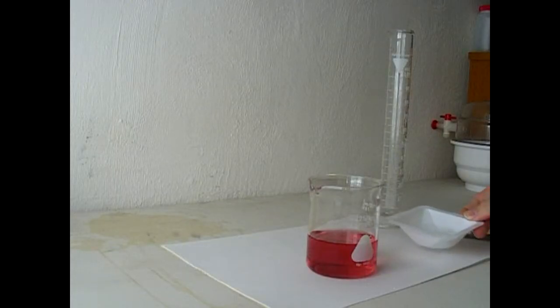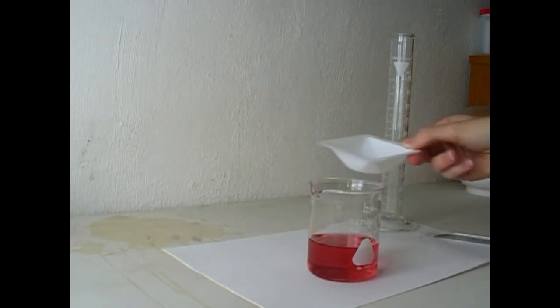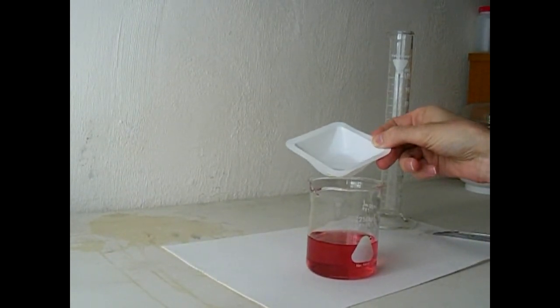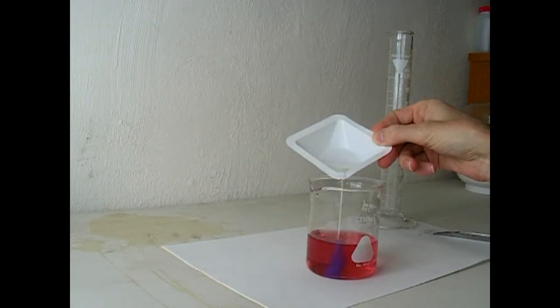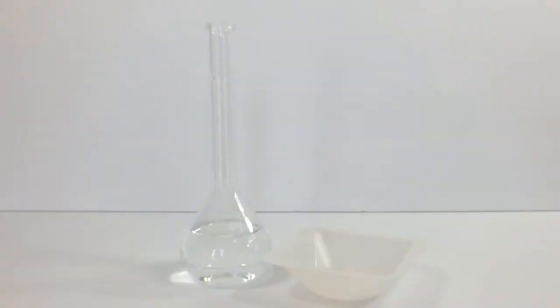Just before I started editing this though, I stumbled across this old video while I was looking for something else. Apparently, this was used in one of my first attempts at filming a chemistry experiment to make a pigment that we'll talk about in a few minutes.